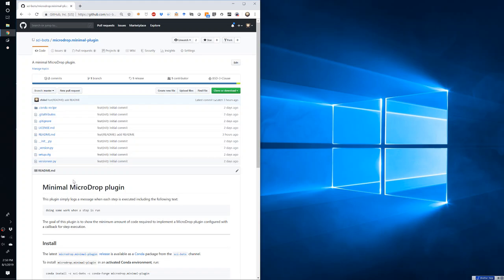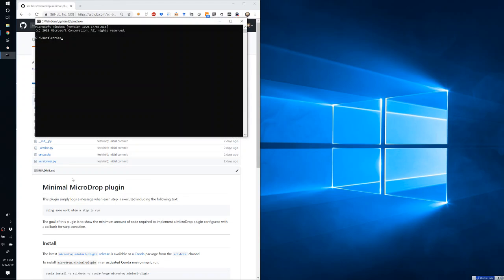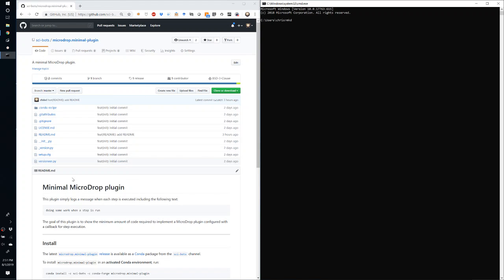The first thing I would recommend is to create a directory to house all of your plugins that are in development. So for example, if you press Windows key R and open a command prompt using cmd enter, then you can run mkdir %USERPROFILE%\microdrop-dev-plugins. In this case, I've already made that directory, but otherwise it would have been created.